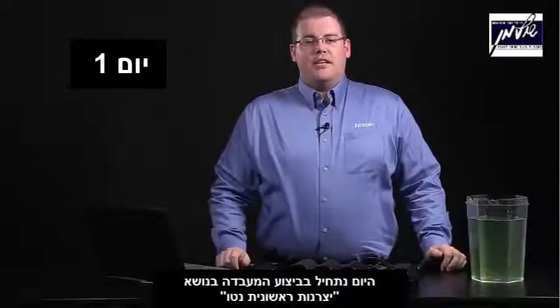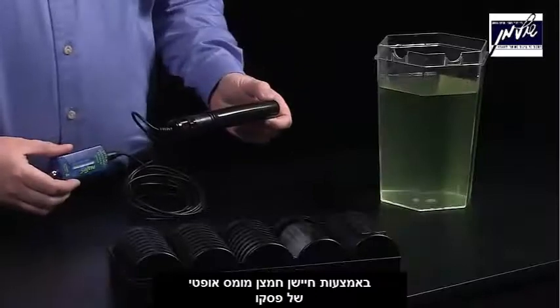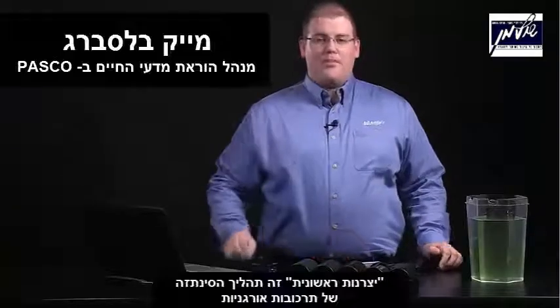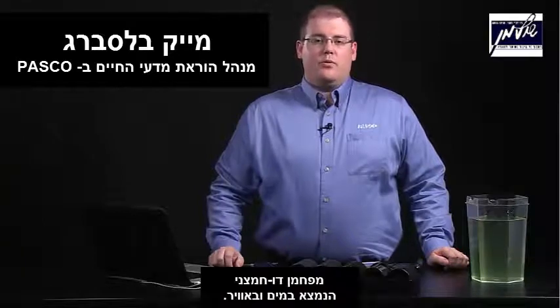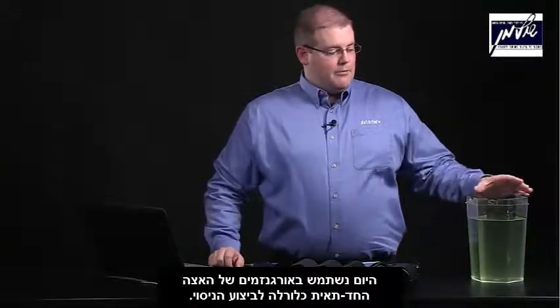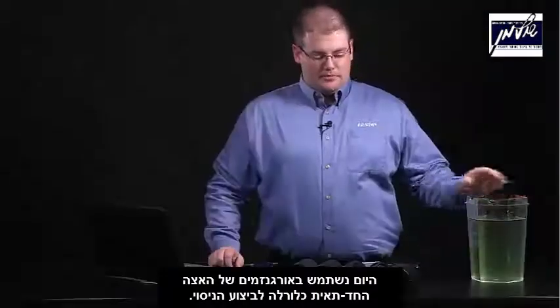Today we'll be starting the Net Primary Productivity Lab using the PASCO optical dissolved oxygen sensor. Primary productivity is the synthesis of organic compounds from carbon found in the water and in the air. Today we'll be using the photosynthetic organisms chlorella algae to do this experiment.